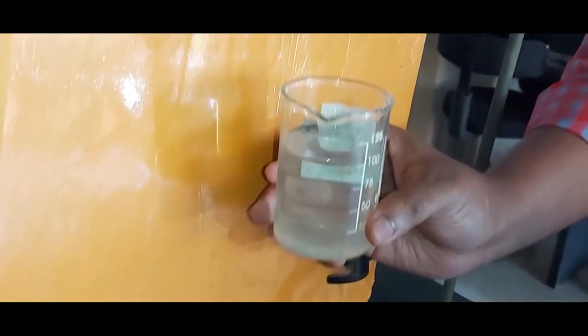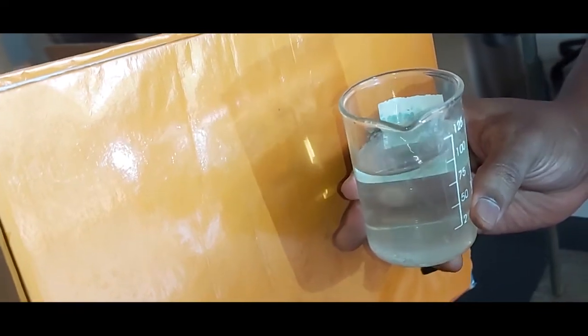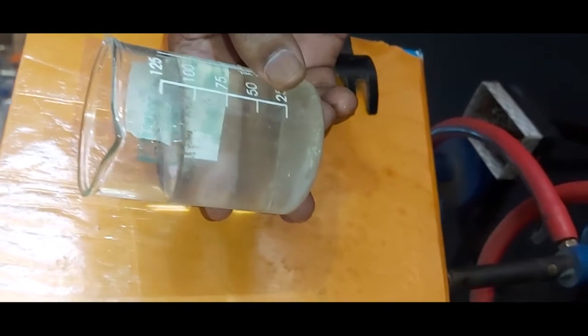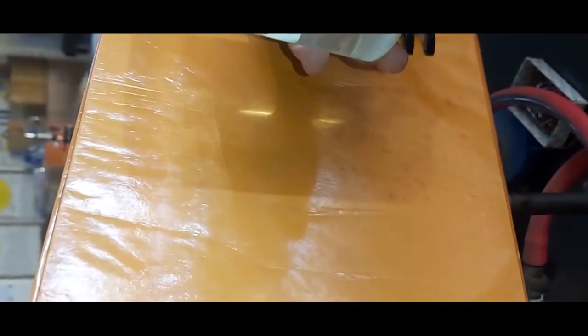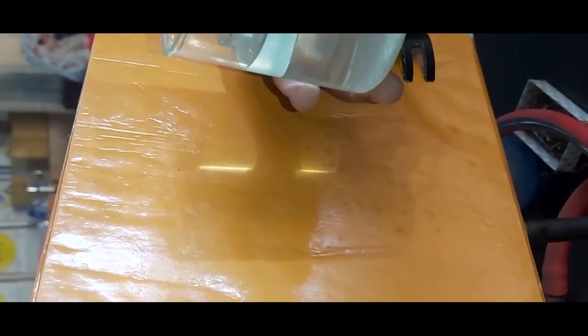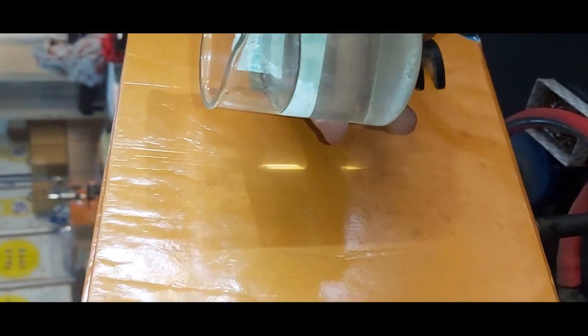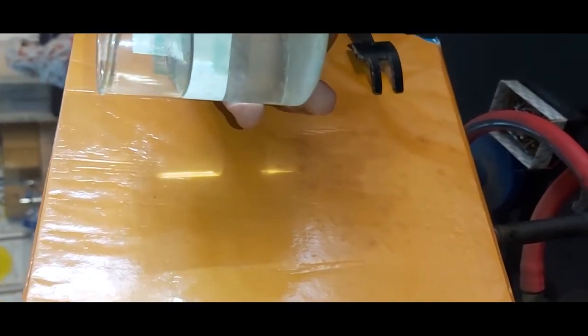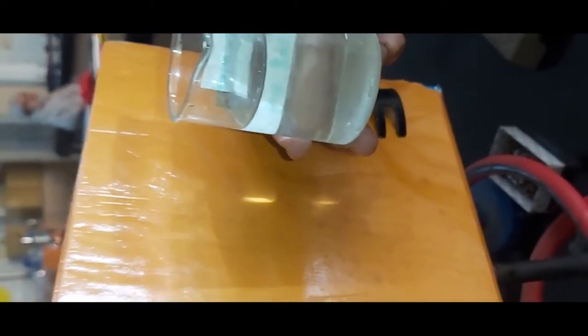The second water sample is the swimming pool water. In this swimming pool water there will be less turbidity. Comparing the two beakers: in distilled water there was a sharp image getting formed on the screen, whereas in swimming pool water there is less turbidity, the water is less polluted and also clear. But the image getting formed is not perfect on the screen as compared to the distilled water.